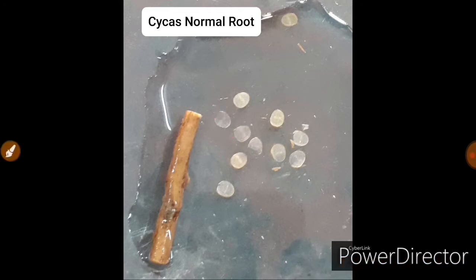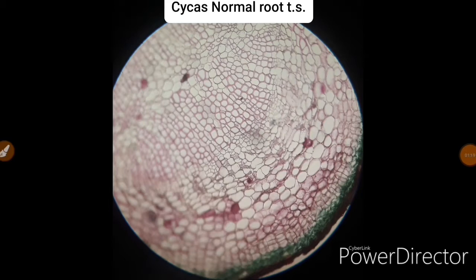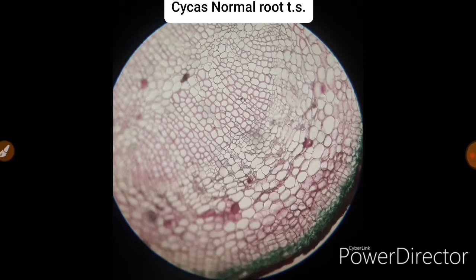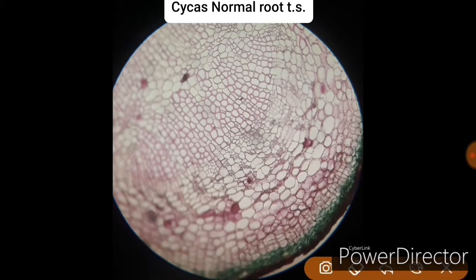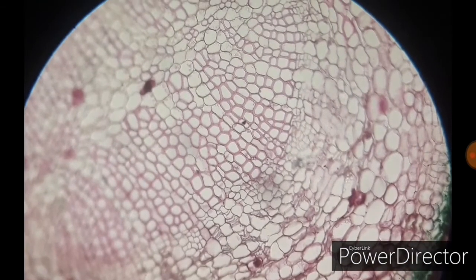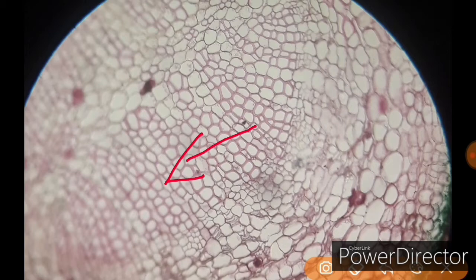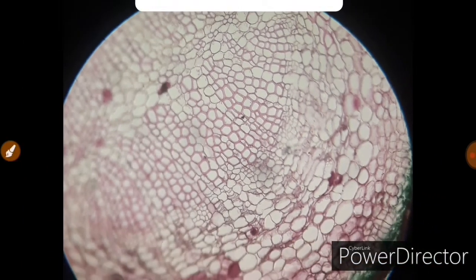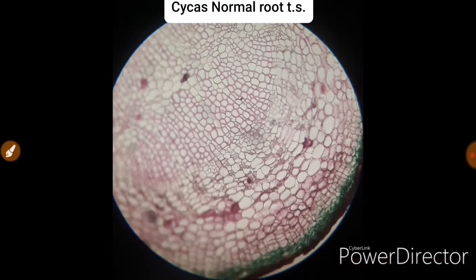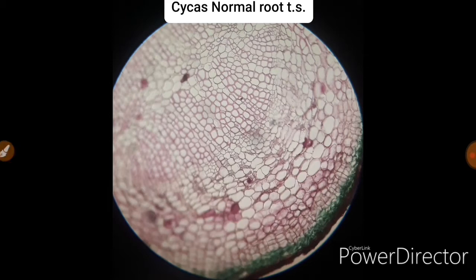This is a transverse section of the normal root of Cycas placed under a compound microscope. In this section you will be able to see all the cells very clearly — this is the xylem portion, these are the xylem cells, the cork cells are also visible outside, and the other cells are also clearly visible. That is what a normal root TS looks like under a compound microscope.